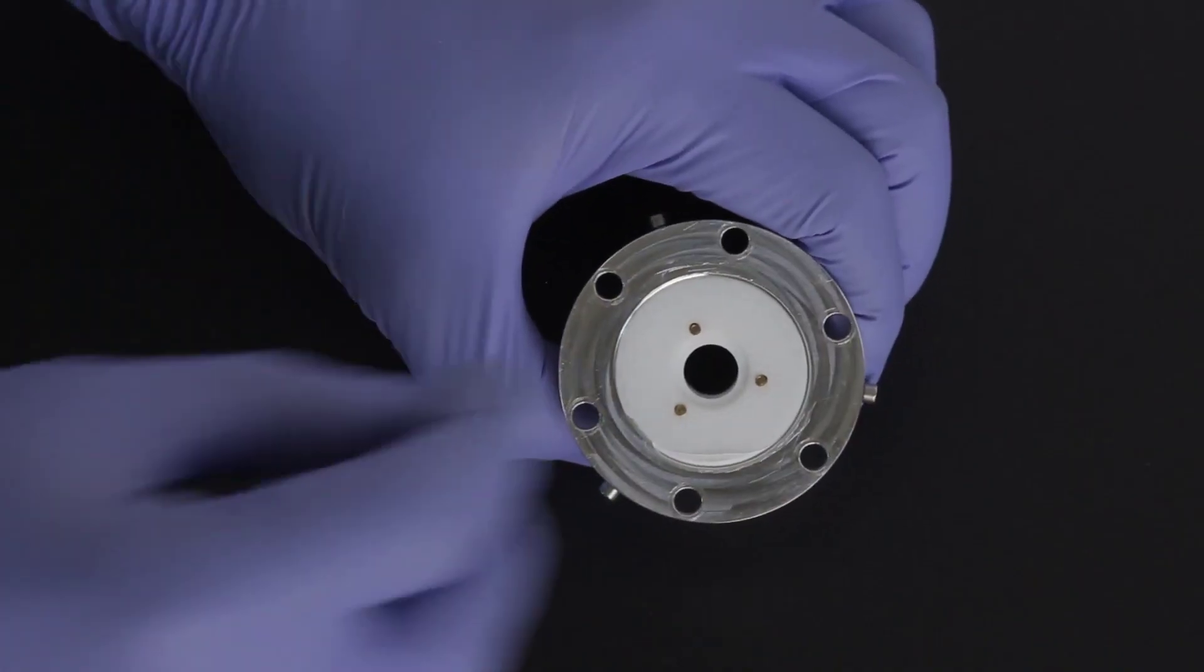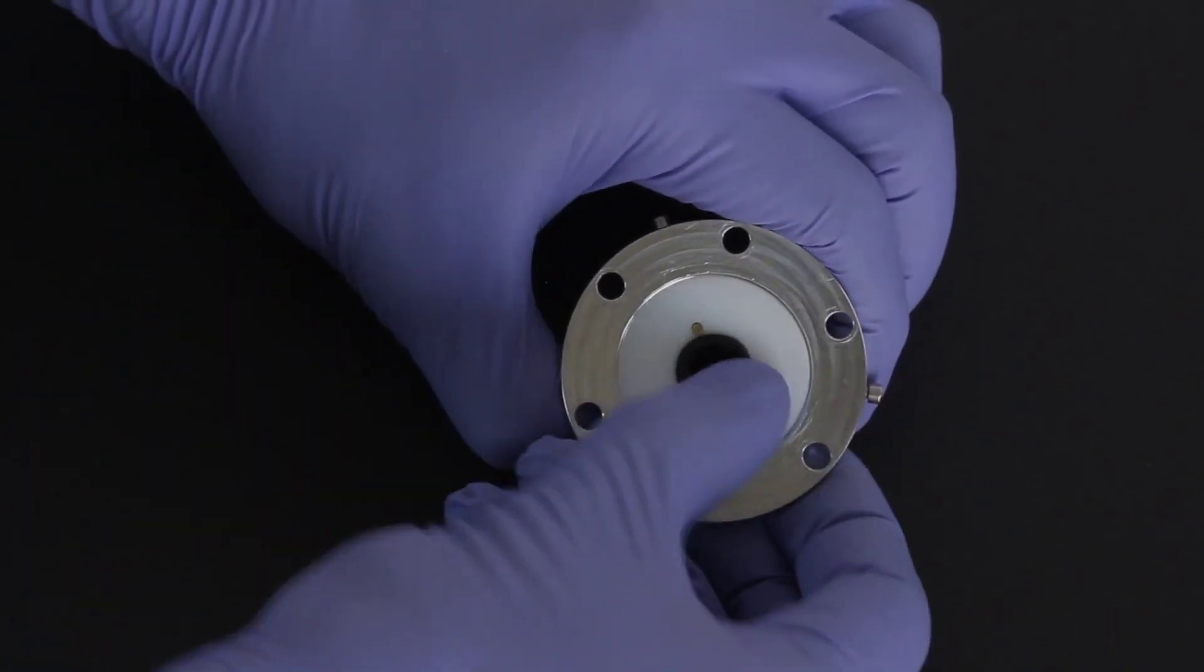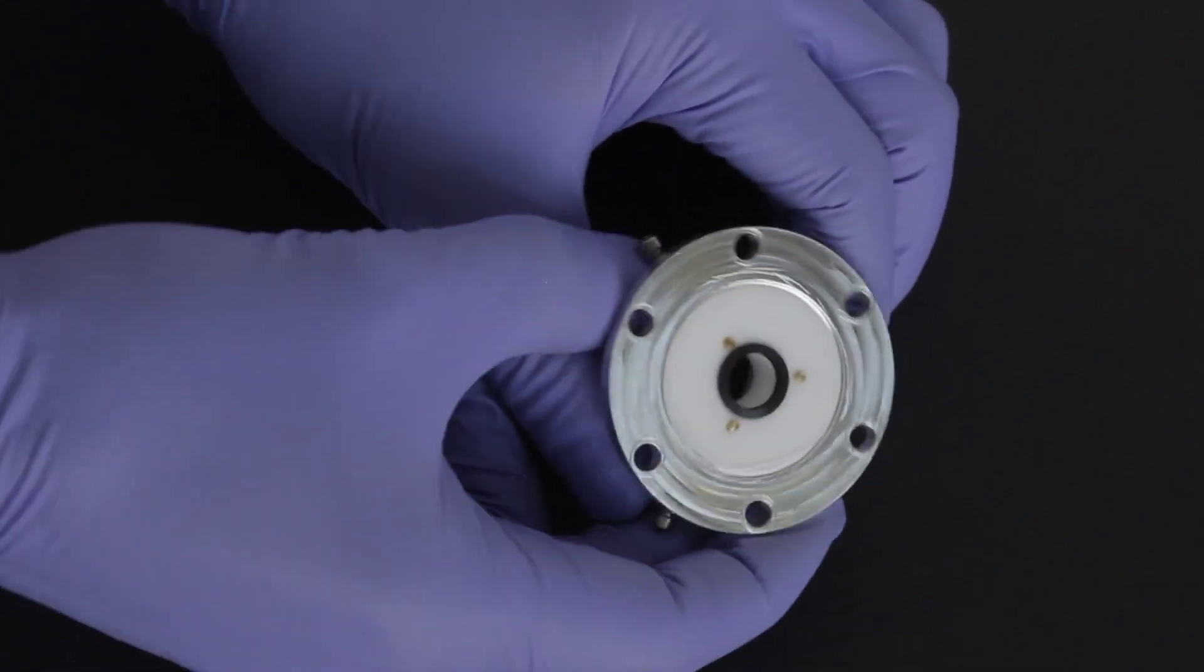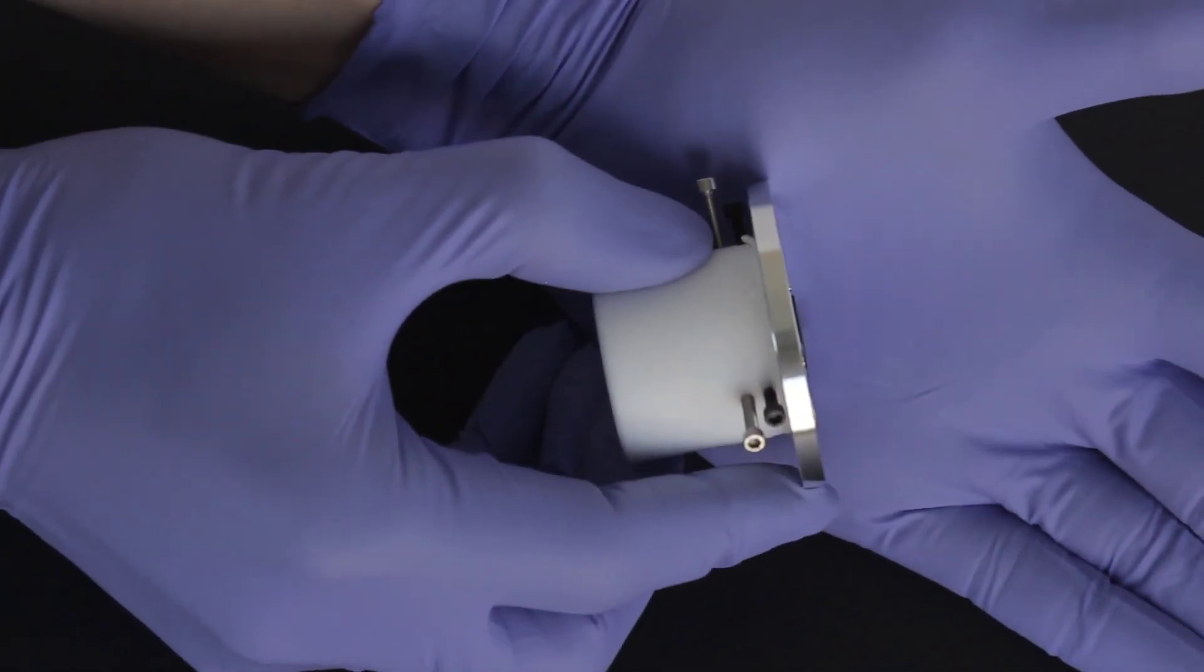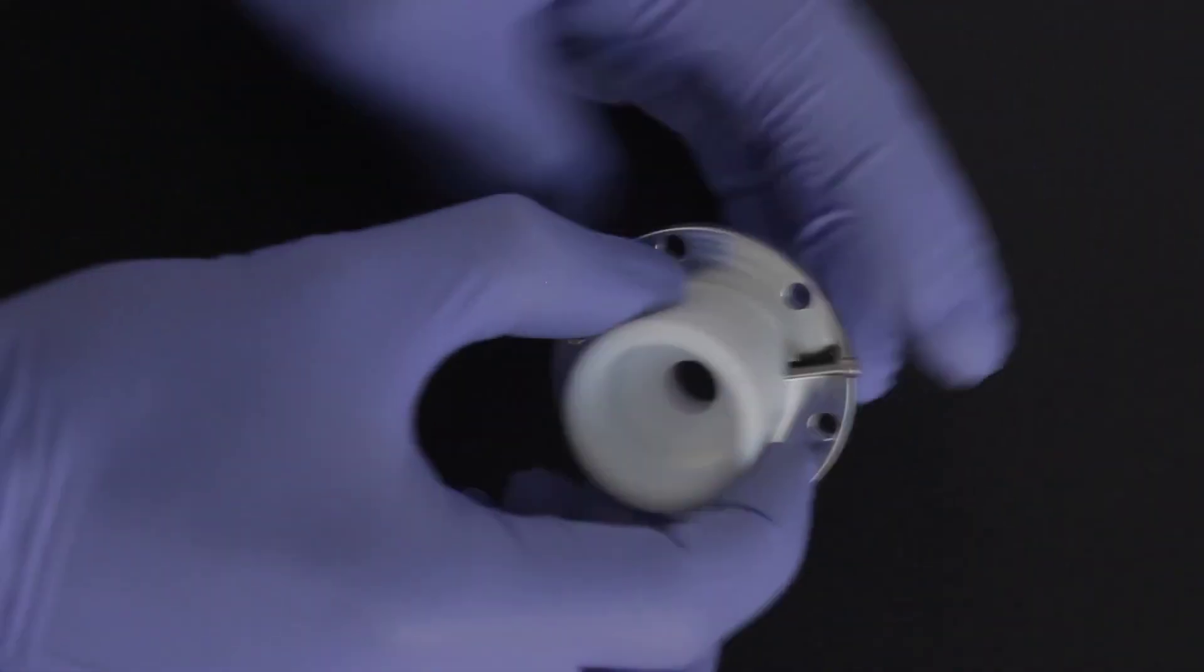Place the lower o-ring into its groove. Look across the bottom of the cell base at a grazing angle and make sure that the o-ring protrudes from the cell base and that the flange is flush with the bottom of the cell base.